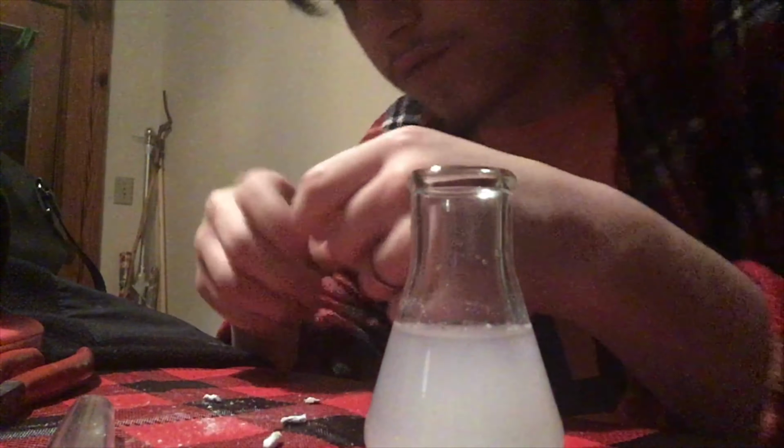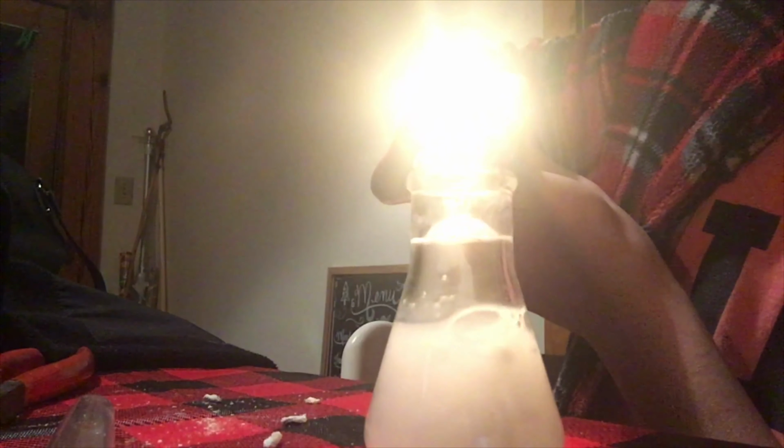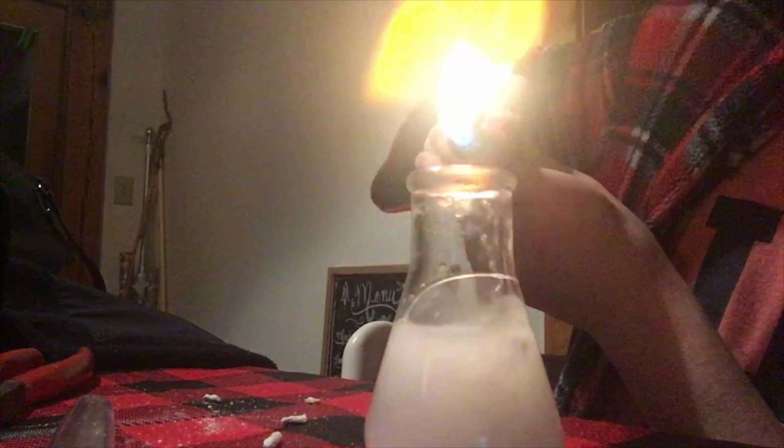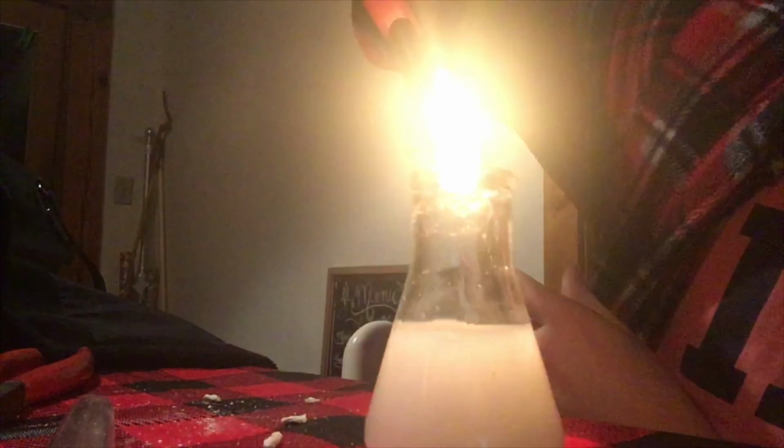But let's see if we can get a little more of a reaction out of this. Let's go for the one I just cut. There we go, it's producing hydrogen.